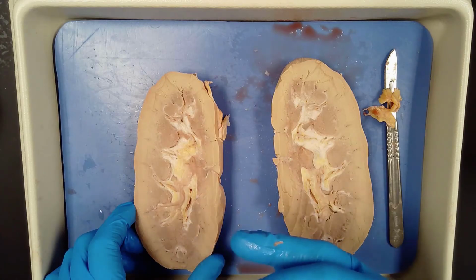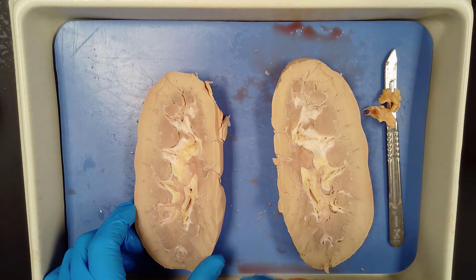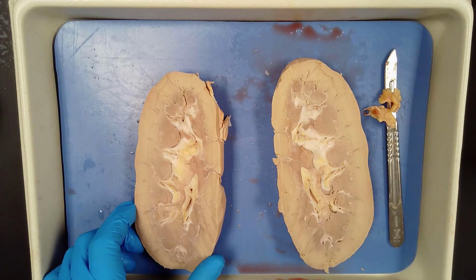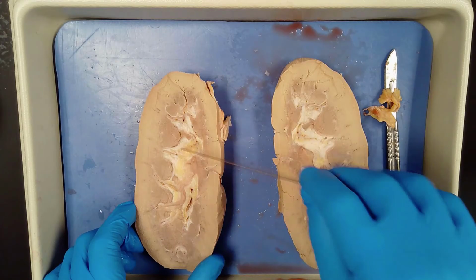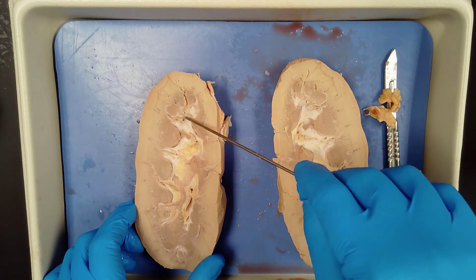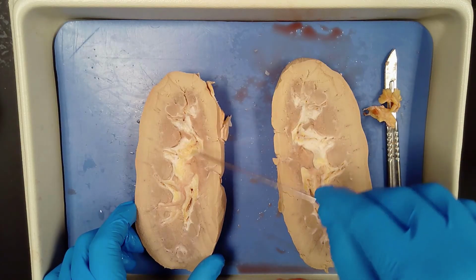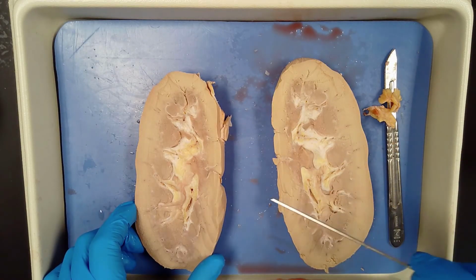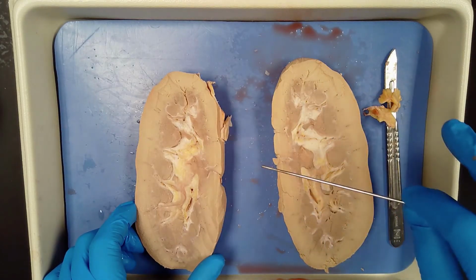It reabsorbs what we need, the substances the body wants to keep, things like sodium, potassium, calcium, water, etc. Anything that's excess is secreted, so we secrete the excess substances, which we talked about, ammonia that's been processed in the liver and becomes urea, and it's transported into these collecting ducts and then again into these minor calyces where they're going to be eliminated from the kidney and then out of the kidney through here in this medial area, out through that ureter.